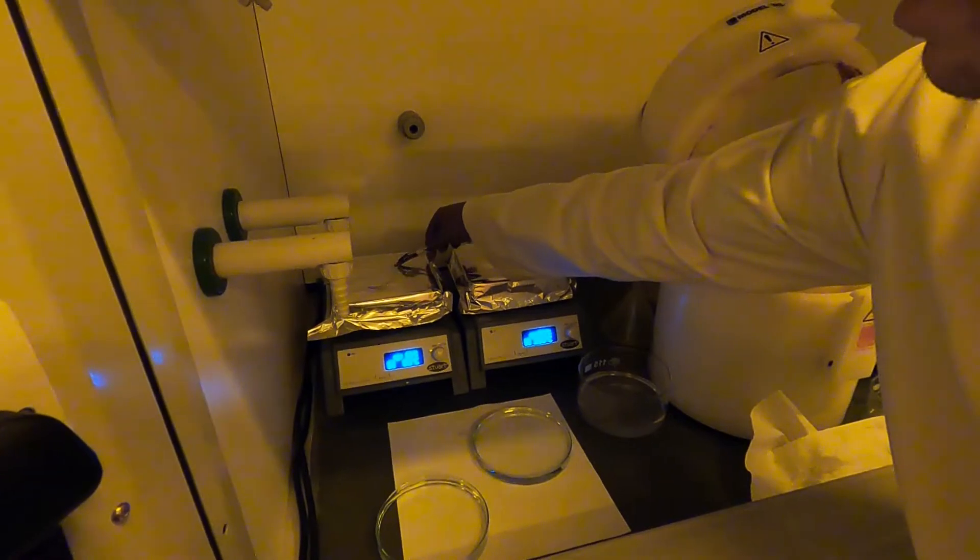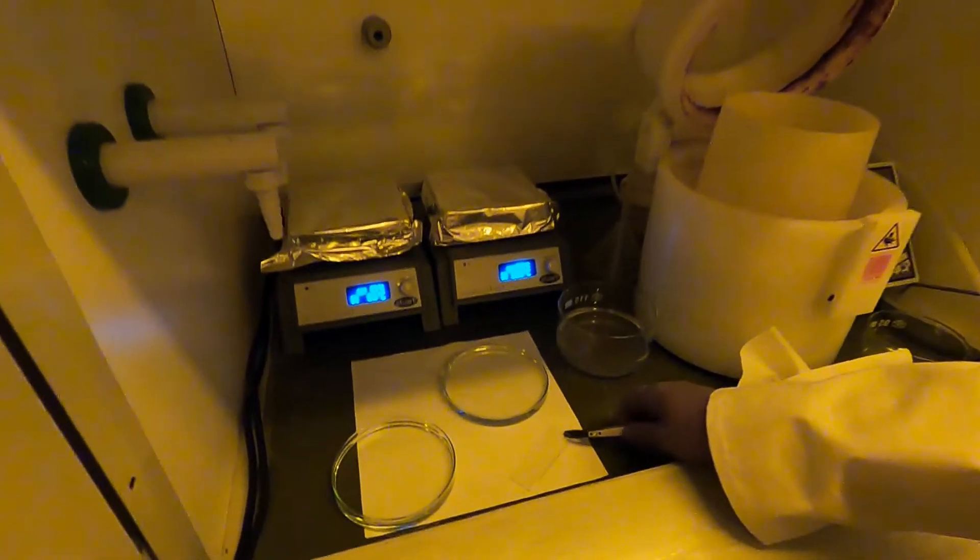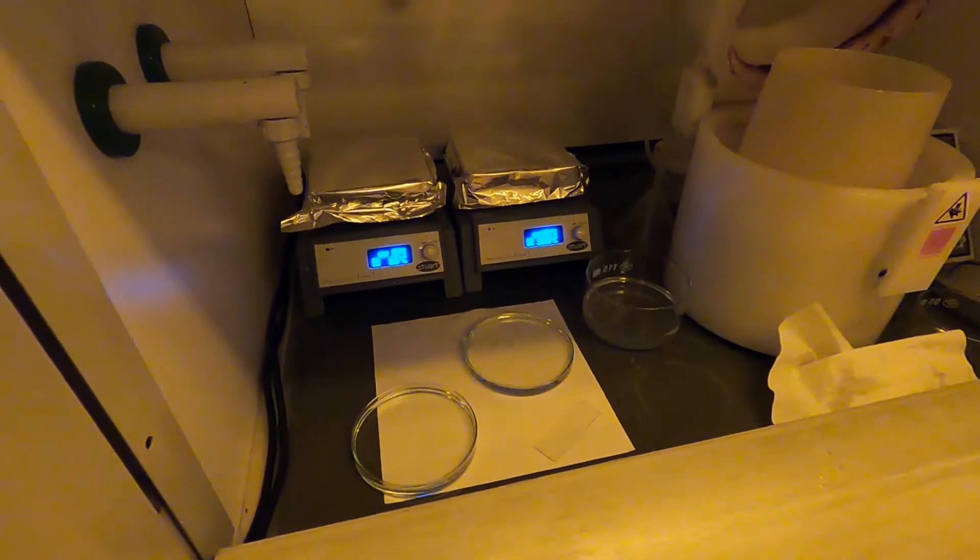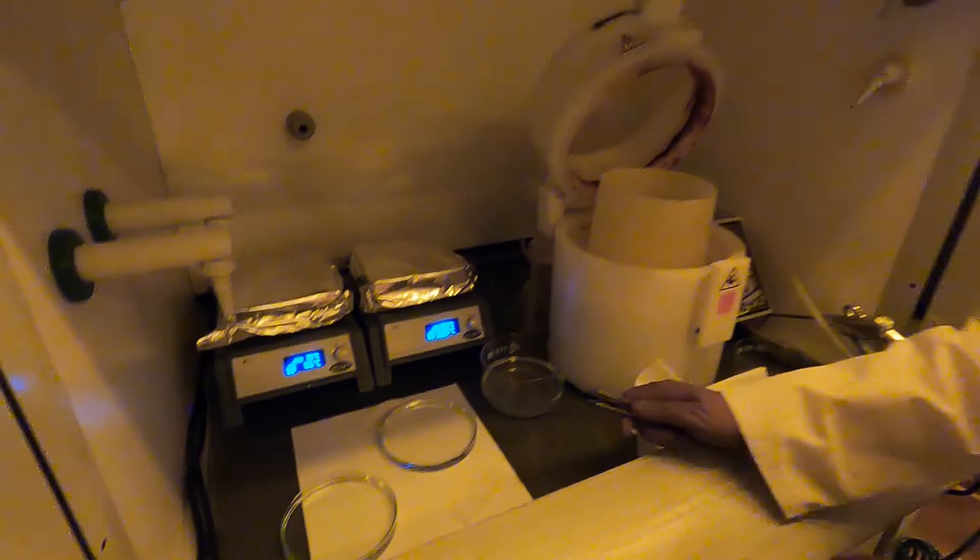It can be a little bit sticky. I'm going to leave it to cool down for about one minute until it reaches room temperature. The next step will be to take the sample, immerse it into the PGMEA, and wait for a certain amount of time.